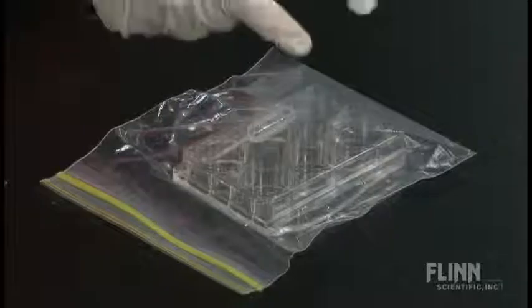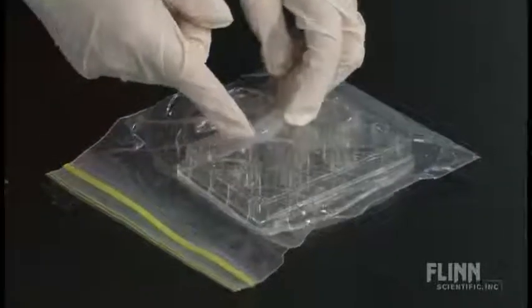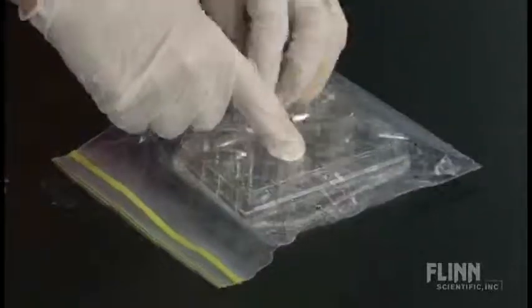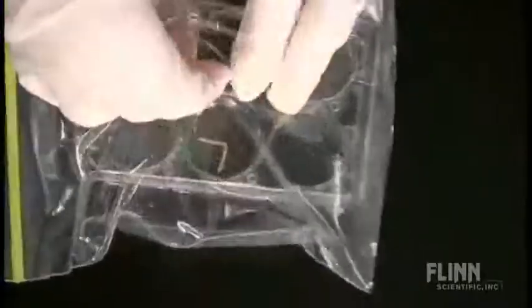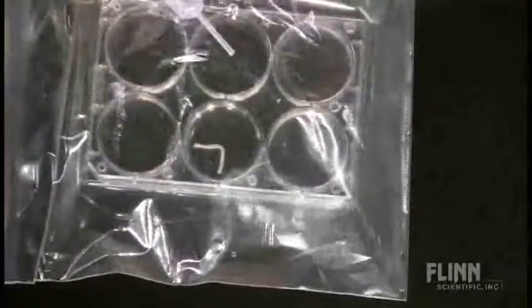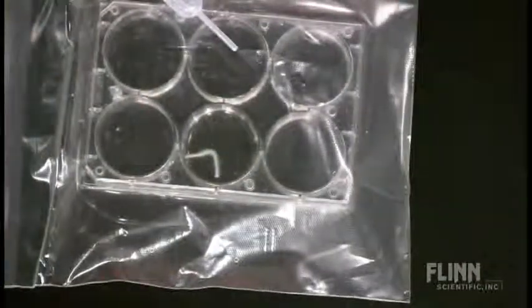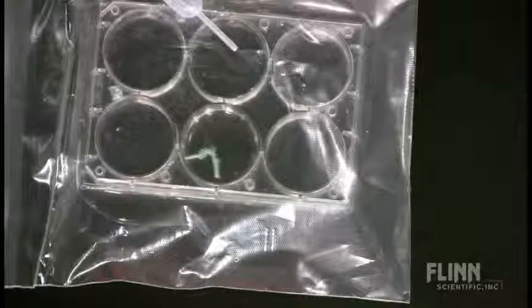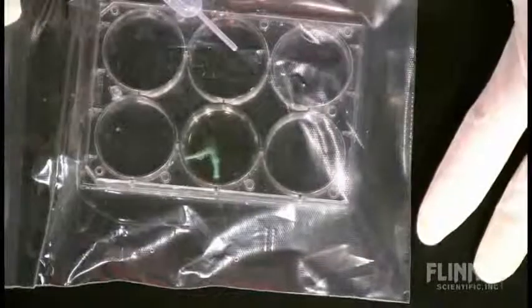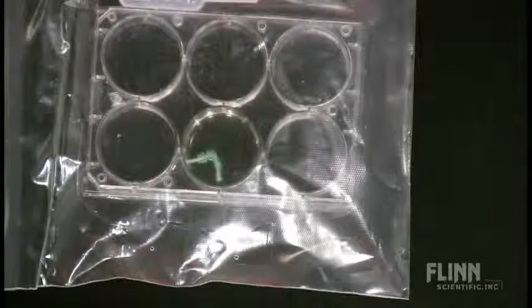So I've got copper, some water in the bottom of the baggie, and my acid in the pipette. I turn the pipette sideways, push the tip down, and squeeze. Get the pipette out of the way. You should be able to see right away that there is a reaction happening. We see some bubbles forming. We should see a color, and the color seems to be concentrated right around the copper, but we can definitely see the bubbles.